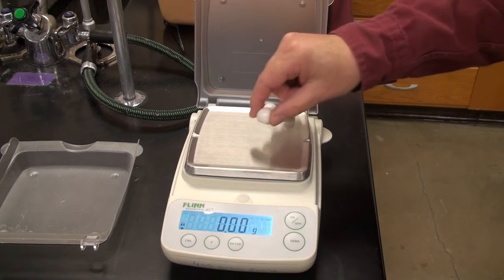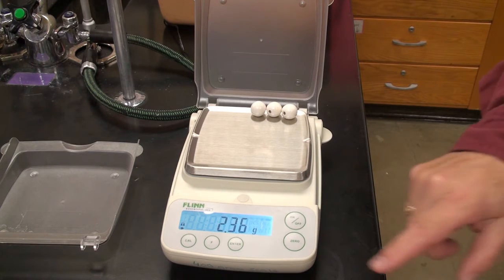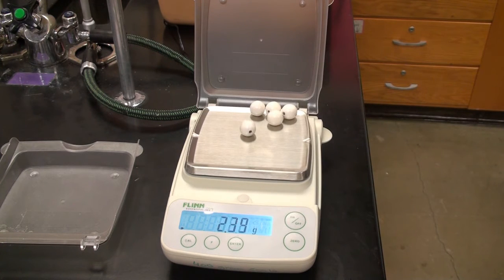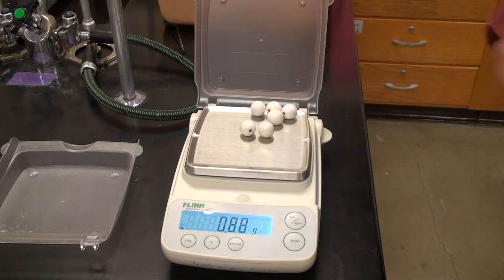Zero it. Here's the third one. Zero it. Here's the fourth one. Zero it. Here's the fifth one. Zero it. Here's the sixth one.